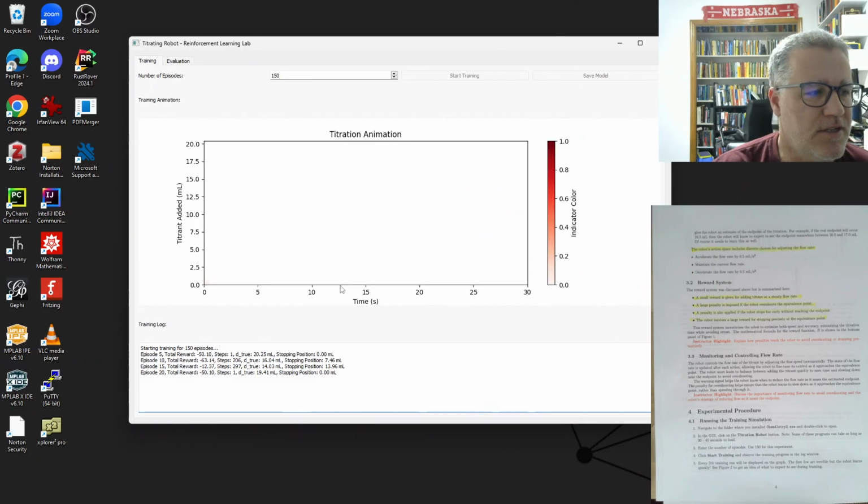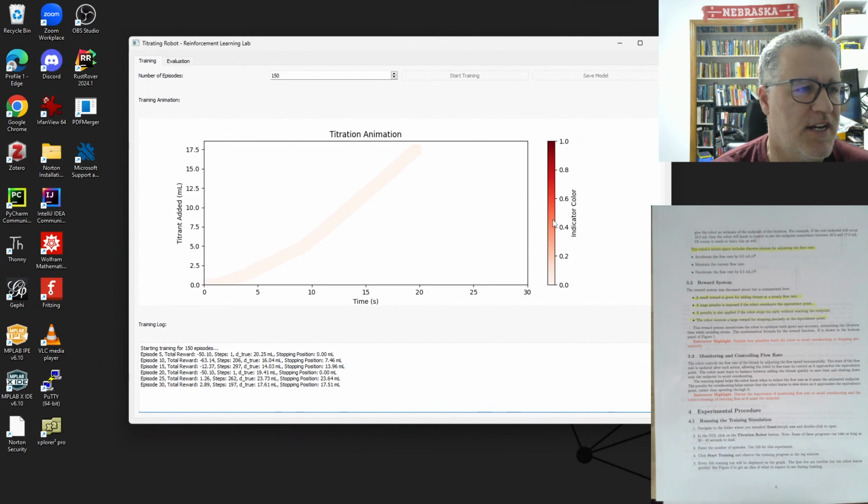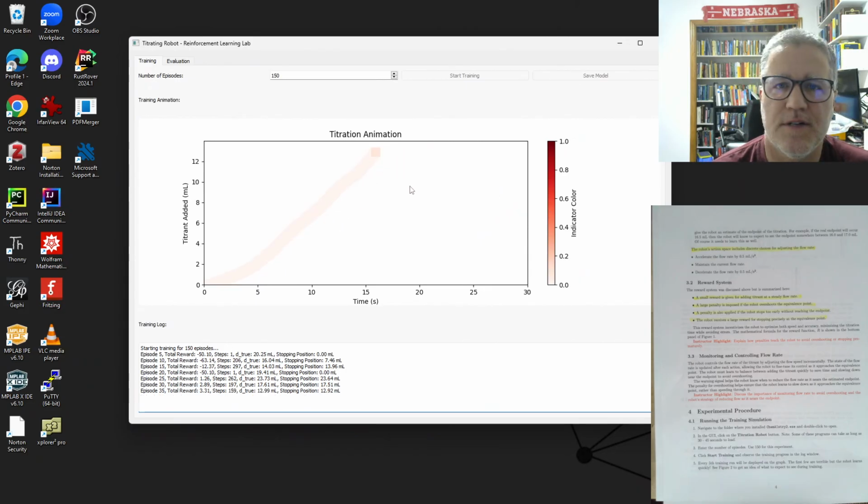Now, as we go, so maybe in some sense this might be good. Sometimes it can get lost, so we'll see if it comes back here. If not, we will start our calculation again. Oh, okay, started to come back. So we should see reasonable. And then these should start getting to be fairly bright, although we don't want to get all the way to this color because that means we're too far. So we're shooting for kind of like this color of our indicator right in here. So about 0.5. And 30 runs. We'll see here we're getting a little bit faster. The slopes are a little steeper, so it's doing it not only getting closer, but it's also doing it better.